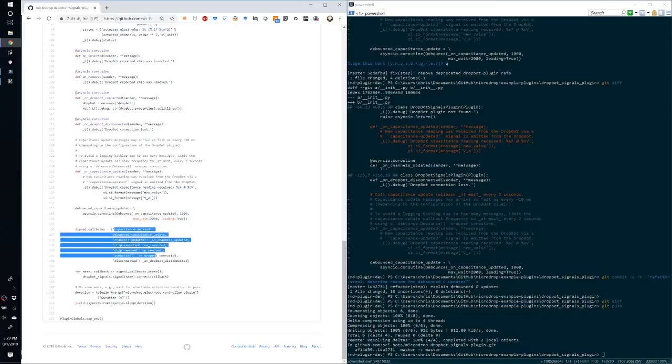We iterate through this mapping from the signal name to the corresponding callbacks, and then we just register each signal with the corresponding signal of that name on the DropBot signals namespace and connect that callback. And then for the duration of this function call, those callbacks are connected. Once this function exits, those callbacks are automatically disconnected from the DropBot namespace.